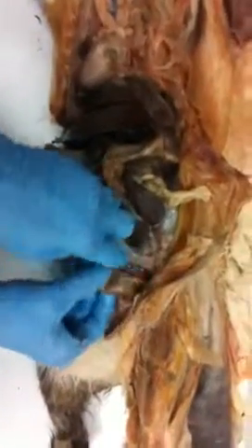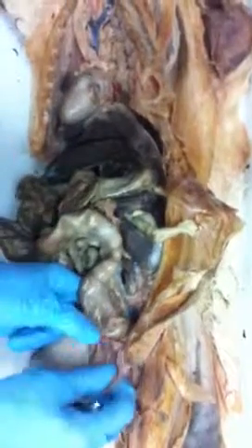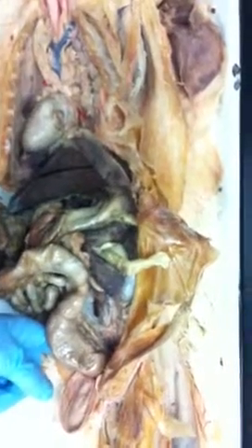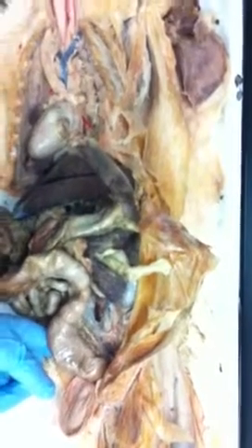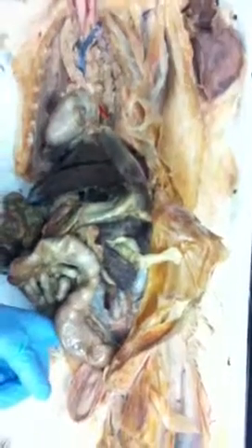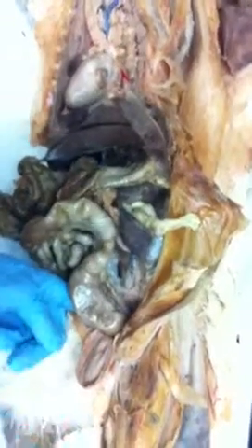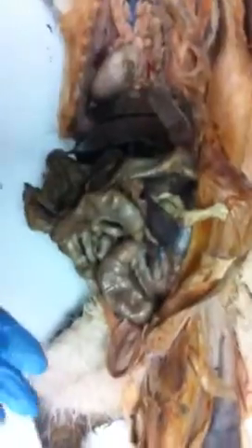That part down here is actually firmly attached to the back body wall by a mesentery membrane down here. This has to be opened a little bit more to see it. But that's just called the mesocolon, and it's a mesentery holding the colon. It holds the colon in the same place. Is that the same thing that's between all the... No, no. That's a mesentery too, but this particular mesentery, its function is to hold that colon in place, that rectum in place, so that we can compact the waste.